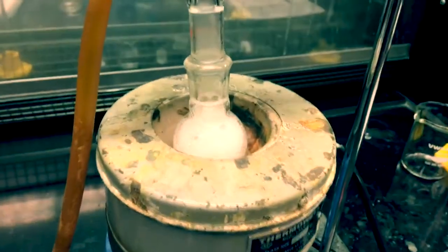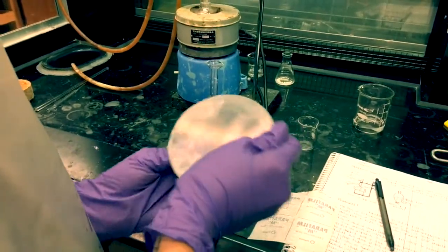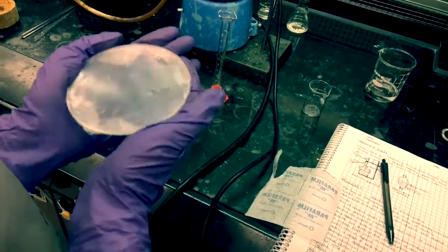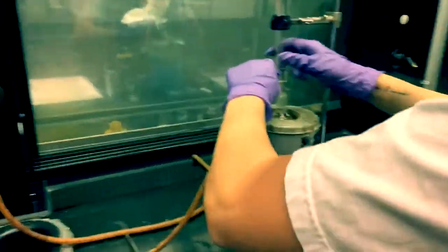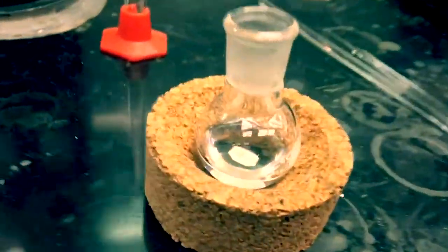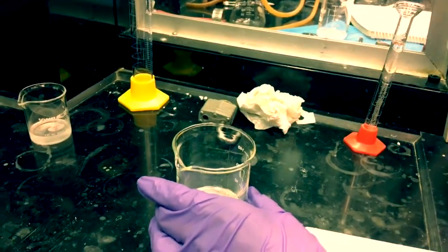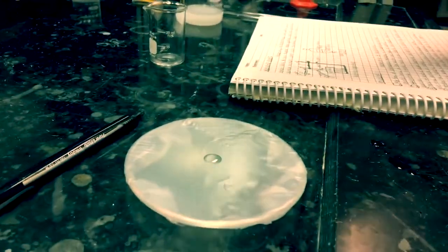If the solution starts to bubble, don't be alarmed — just reduce the heat. After 20 minutes have passed, allow the solution to cool to room temperature. As you wait, place a piece of parafilm on a watch glass and make sure to completely cover the watch glass. After the solution has come to room temperature, pour about half of the mixture into 25 mL of methanol to precipitate polystyrene. Collect the white precipitate of polystyrene by allowing the solid to settle and decanting off the methanol. Then, place a few drops of the remaining half of the reaction mixture on the parafilm and allow the polystyrene to dry until the following lab period. Observe the different forms of polystyrene that are isolated.